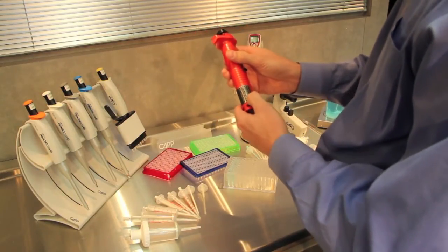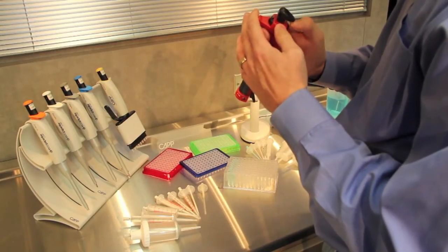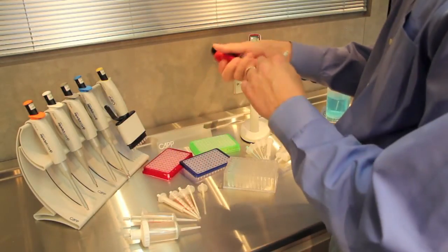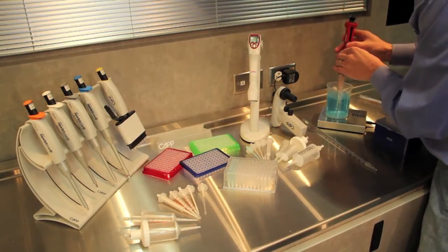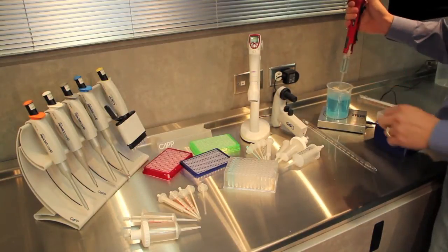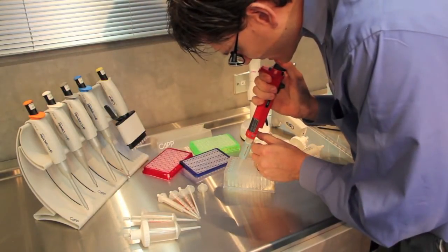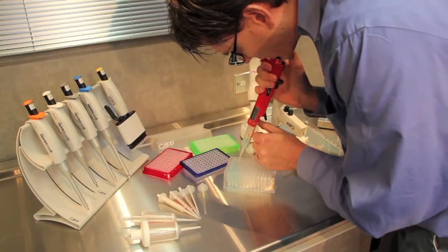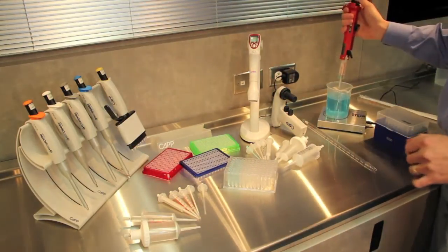In this example we're going to be doing 1ml, so we will set the unit on four and we will use the 12.5ml syringe. We aspirate up the liquid, dispense out in the air. Now every time I press the button on top, this unit is dispensing 1ml, so you can see it's accurate as well as much faster.